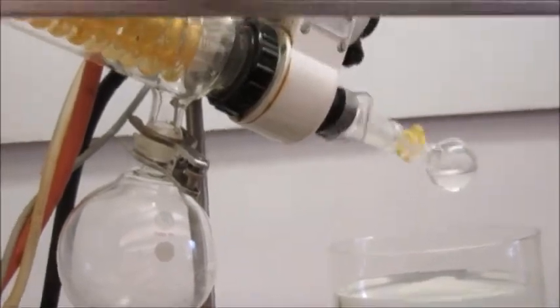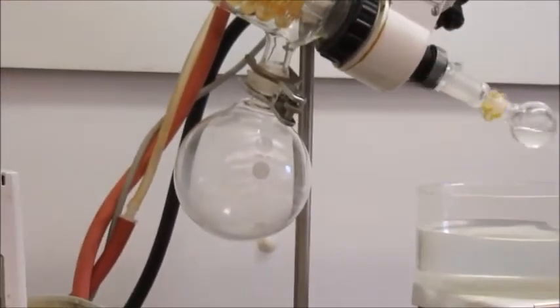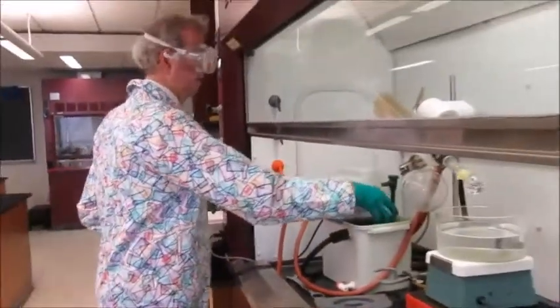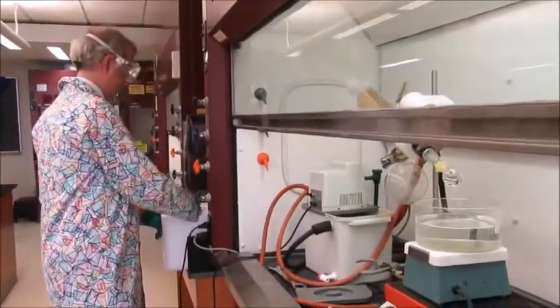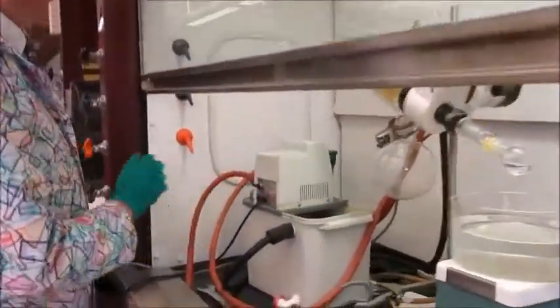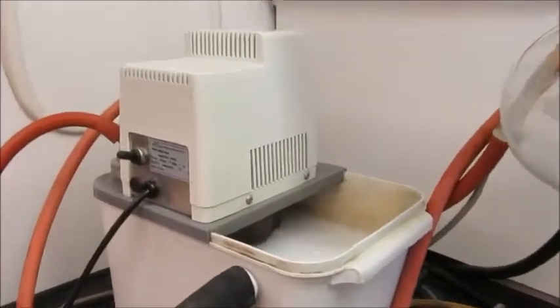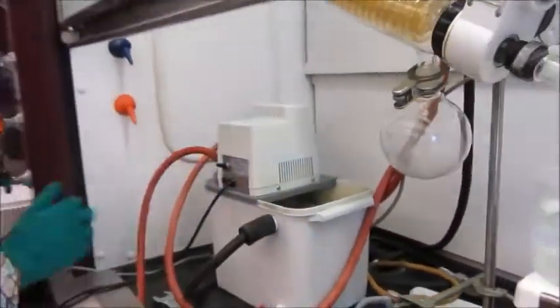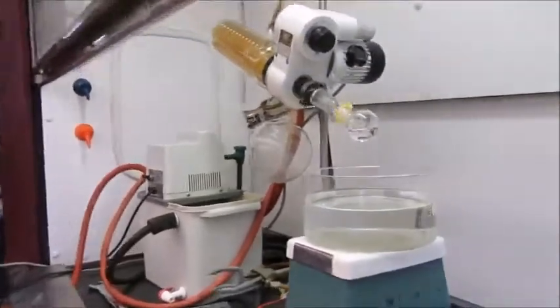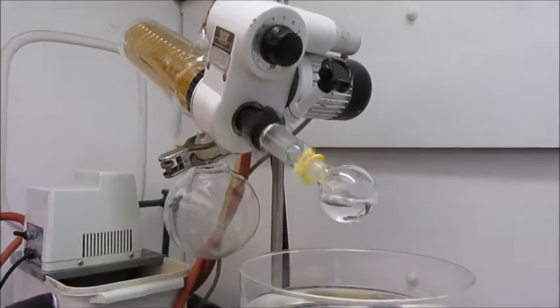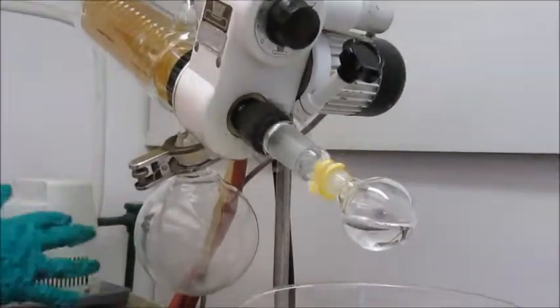This rotovap is pretty old. I'm going to throw in some ice into here. The vacuum you get from a water pump of this type is limited by the vapor pressure of the water, so if I throw in some ice, I get a bit more action, and that will help the stuff come over.